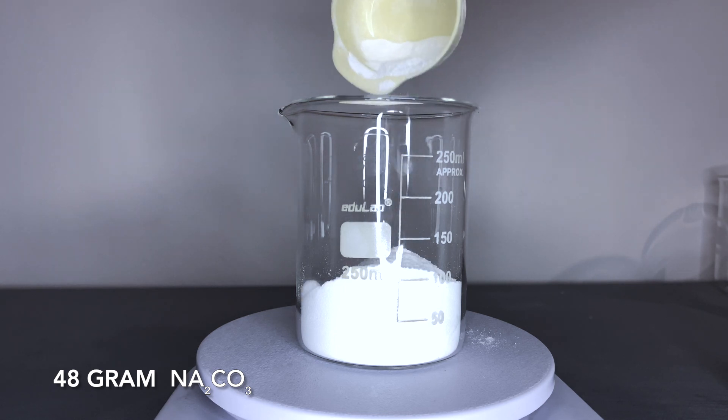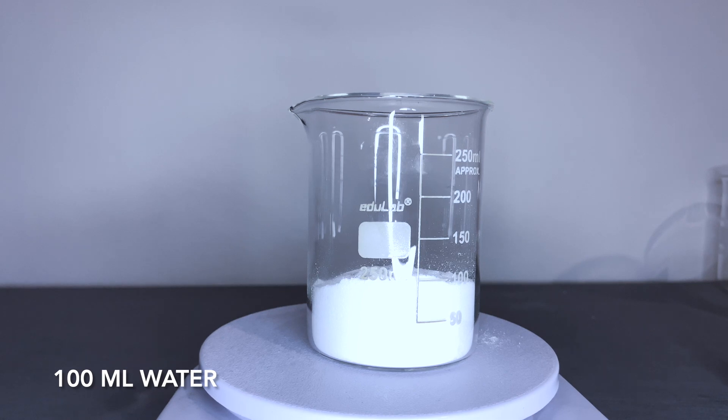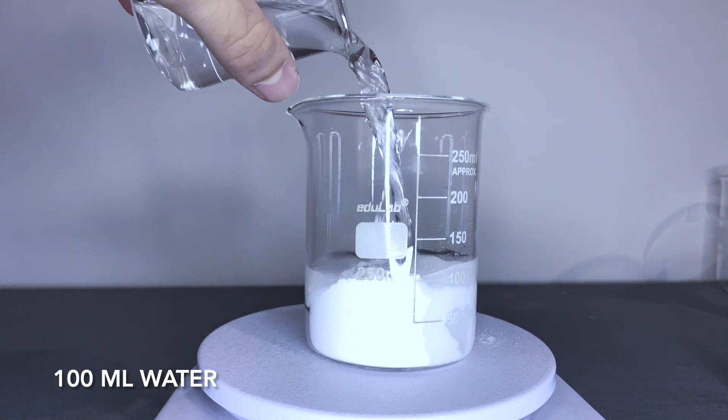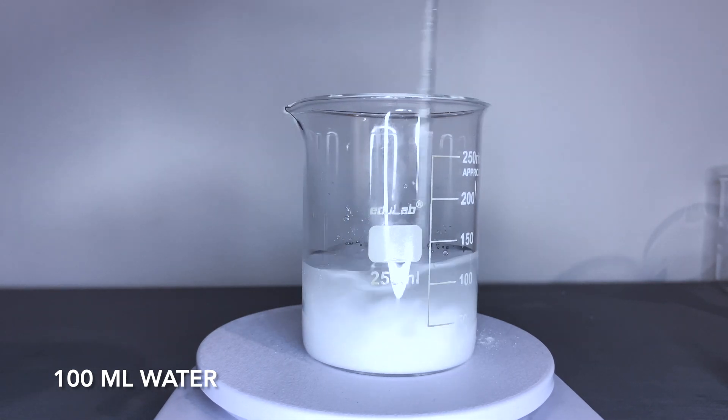For this experiment, you just need sodium carbonate and copper sulfate salt. You can get them legally in your local hardware store. And you can make this experiment in your home. I think it's a good way to learn and like chemistry at your own.